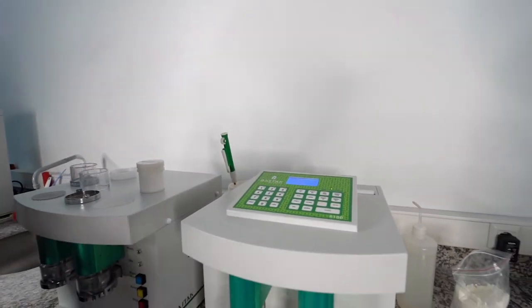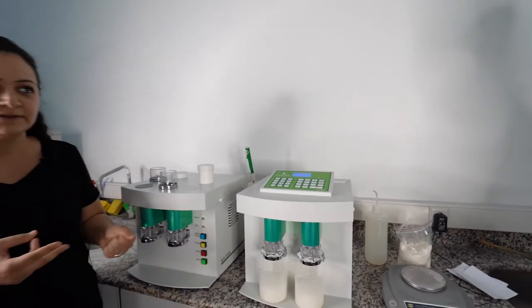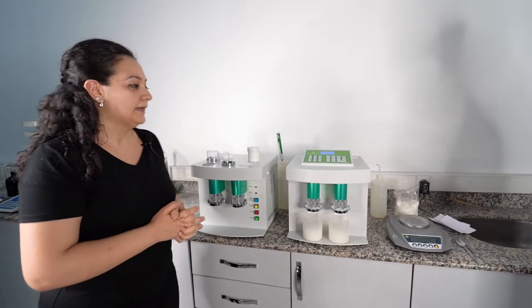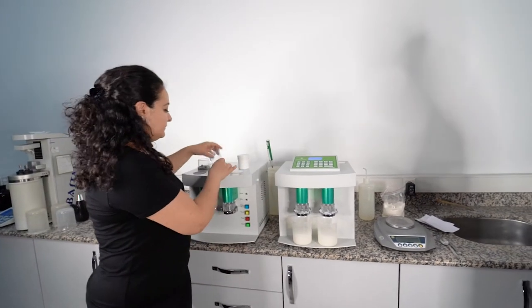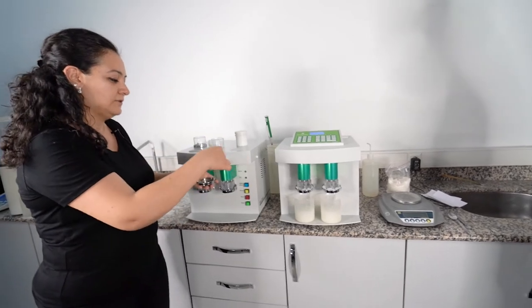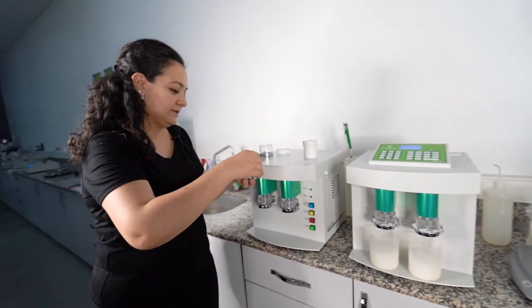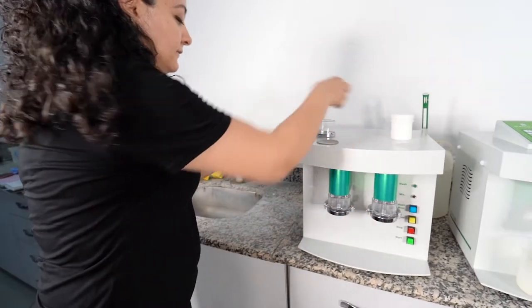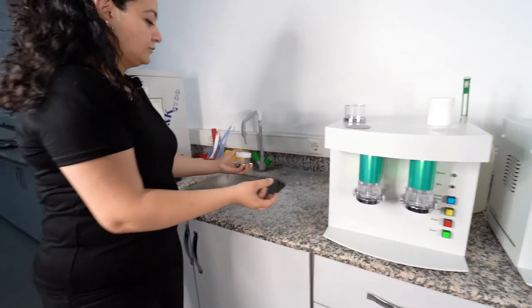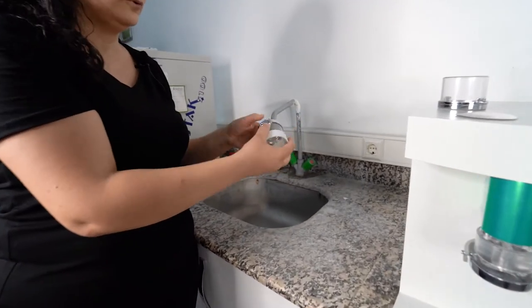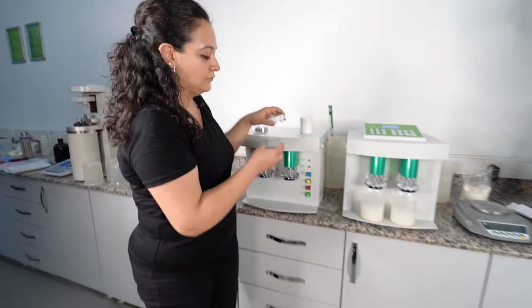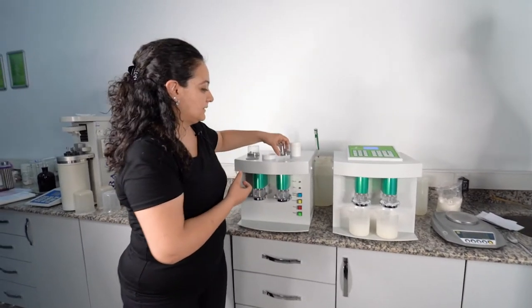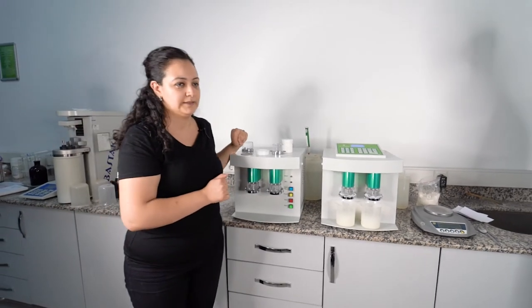It is mixing 20 seconds and it is washing 2 minutes, and then after 2 minutes the machine stops automatically. You should change your materials. You should take your sample to this one under the water, and then you can continue 3 minutes with this ring. After 3 minutes, the machine stops automatically.